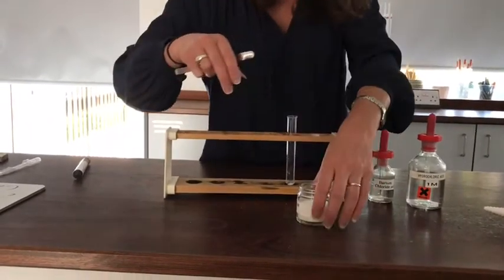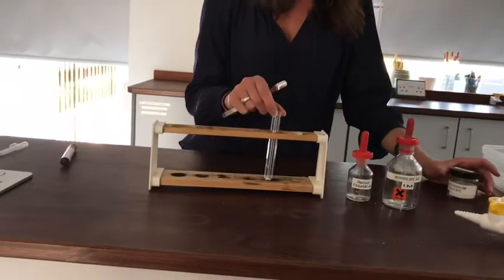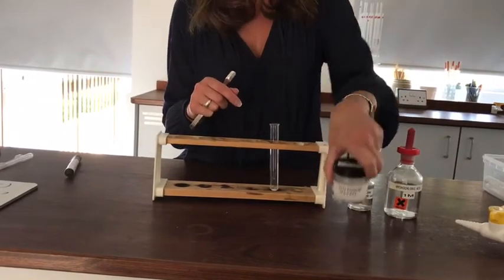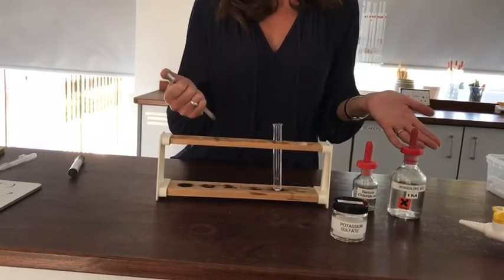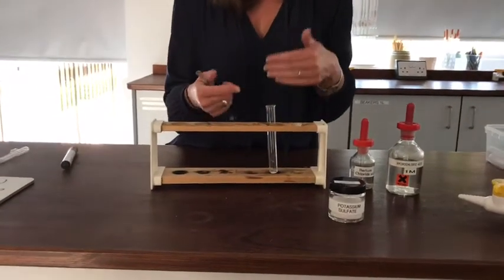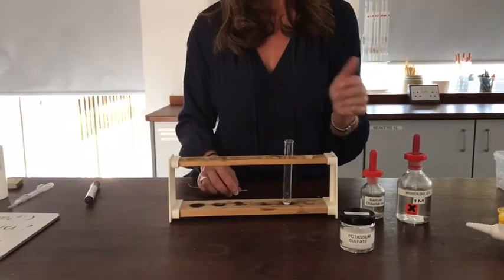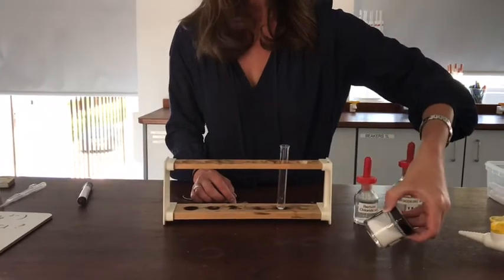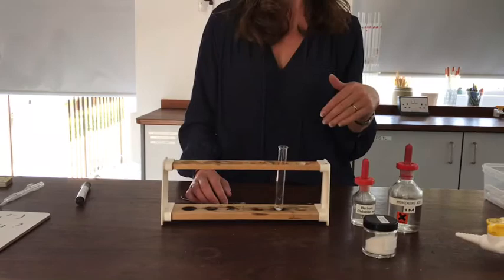And now I'm going to do a test which wasn't necessary with the carbonate ions. I have to add some acid to this first, and the reason for that is that my sample, although it should be pure potassium sulfate because I've got it from the prep room, if I were testing an unknown, I wouldn't know if it was a pure chemical or not. And it's very easy for there to be things mixed in with it that might cross-contaminate my test and give me a false positive. So things that can do that are hydroxide ions and carbonate ions. So if there were any potassium hydroxide or potassium carbonate mixed in with this, then I get a false positive when I was trying to do my sulfate test.